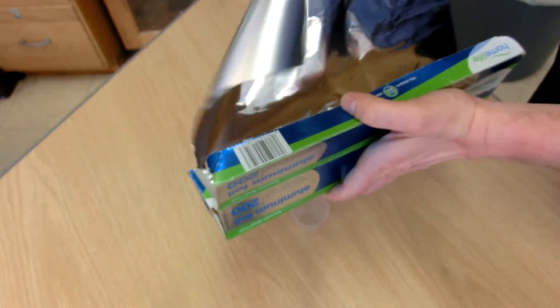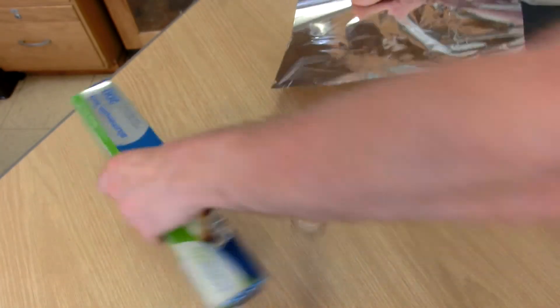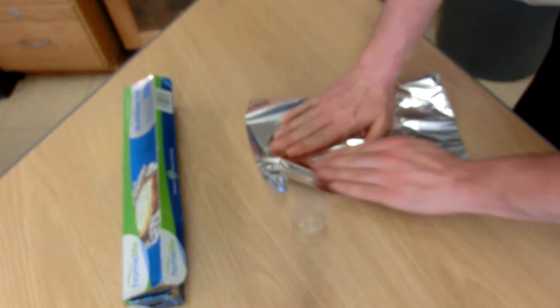Since I didn't have those on hand or my regular crucible, I did have aluminum foil. So here's what I did.